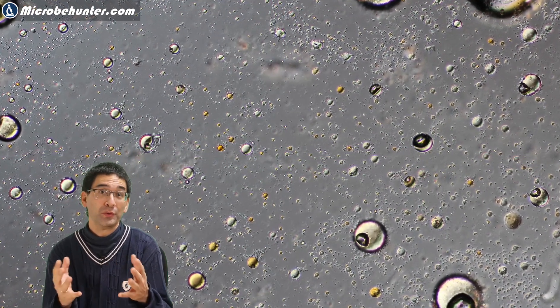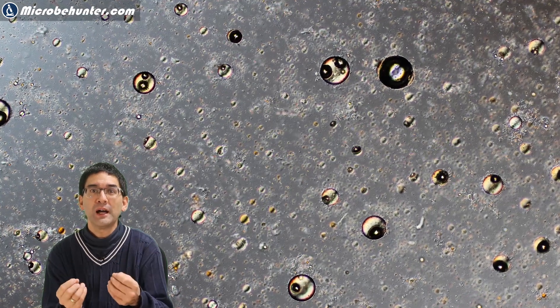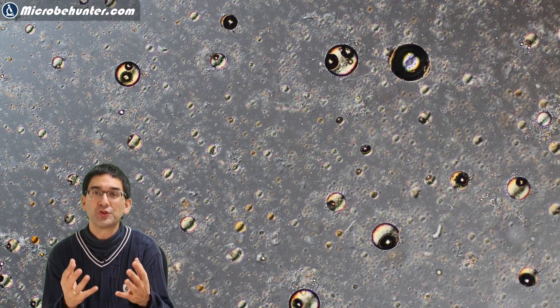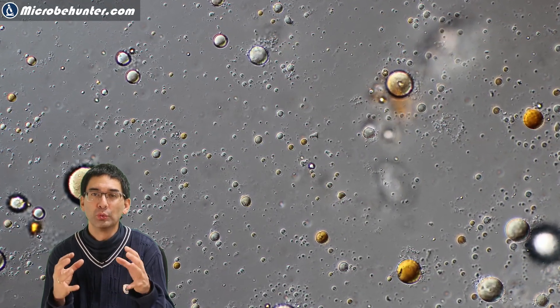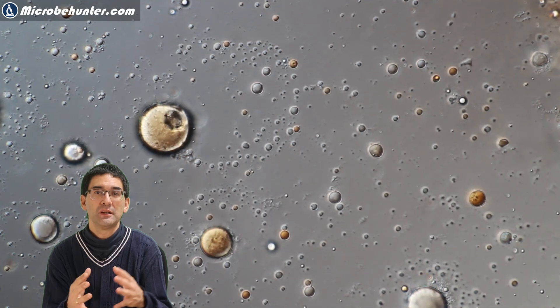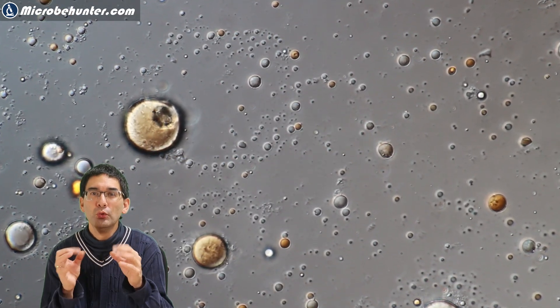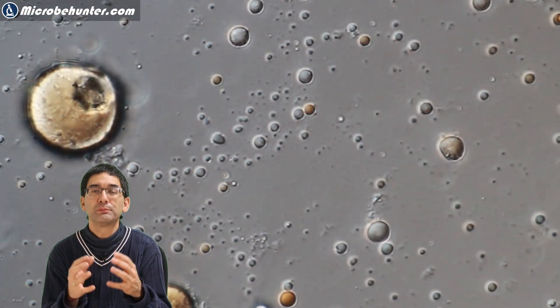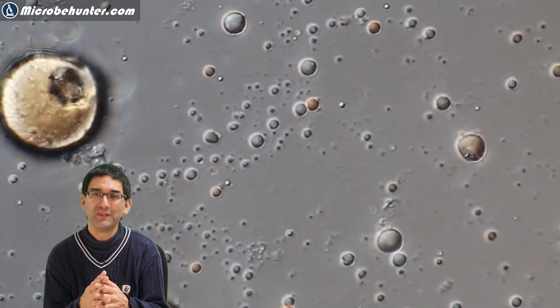These are microscopic fat droplets surrounded by water. And where do they come from? The noodles were fried in oil during the manufacturing process to preserve them, and there is a bit of oil left on the noodles. Some of the droplets, especially the smaller ones, they seem to be moving — they are shaking. And this is because of Brownian motion, and that's the topic of another video.